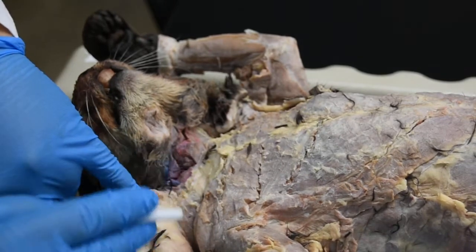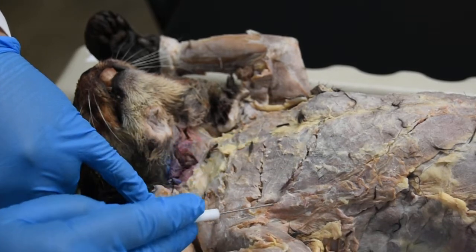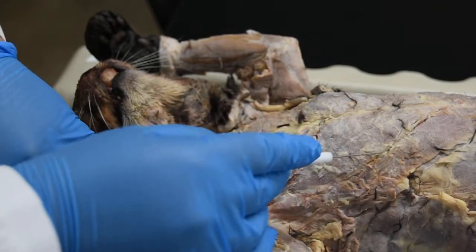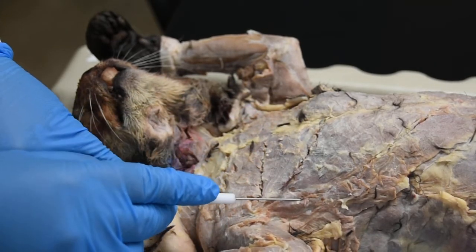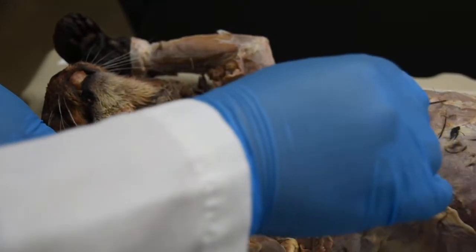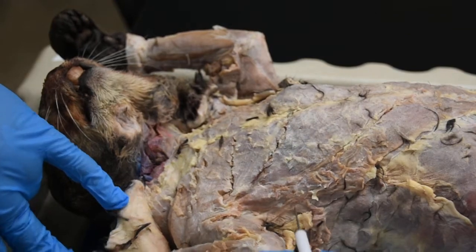The next muscle you see right here separated is called pectoantebrachialis. Next one you have, which is that triangular muscle you see right here, is the pectoralis major. Pectoralis major is followed by this parallel muscle you see right here, this large one called pectoralis minor. And then the last one, which starts at the end of the xiphoid process and then goes underneath the armpit, is called the xiphihumeralis.